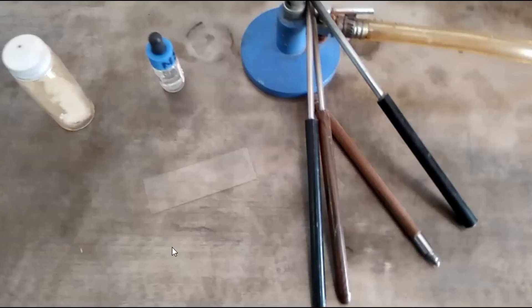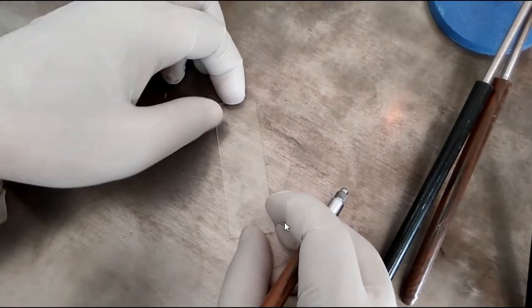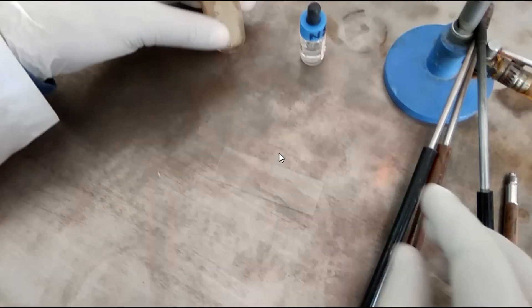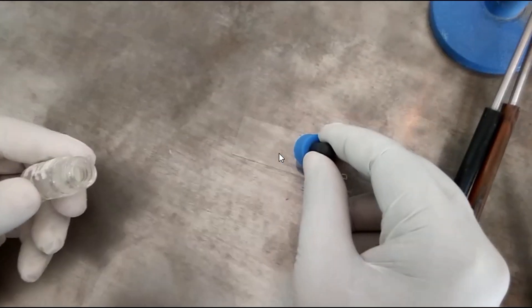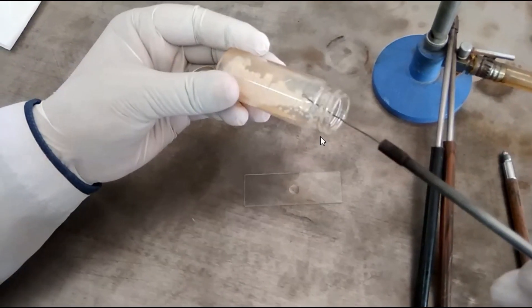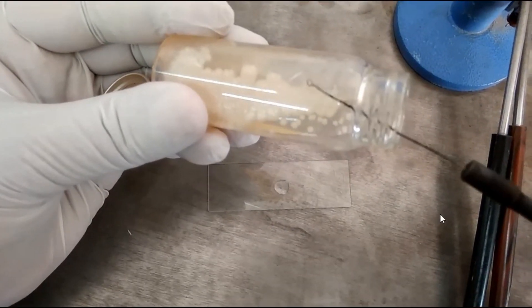Take a clean grease-free slide. First, level the slide in this way. Now put a drop of normal saline. Pick up a colony using the inoculating loop in this way, and finally mix.